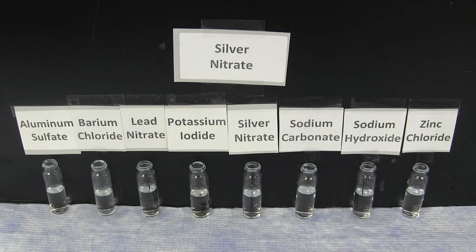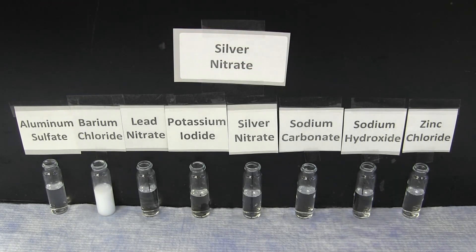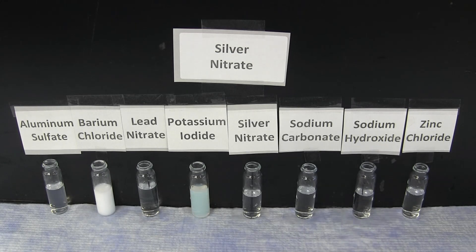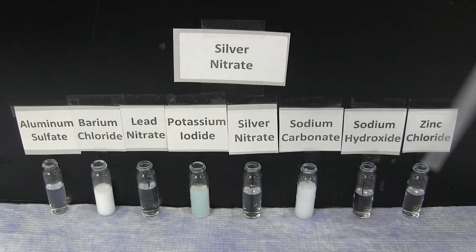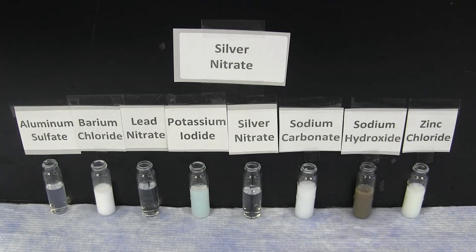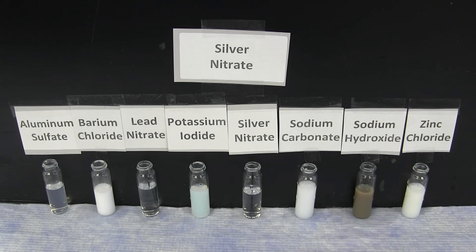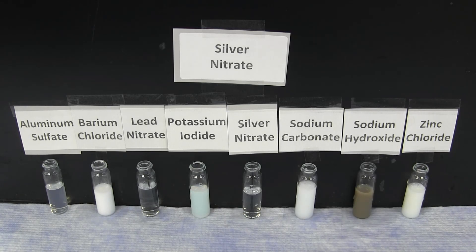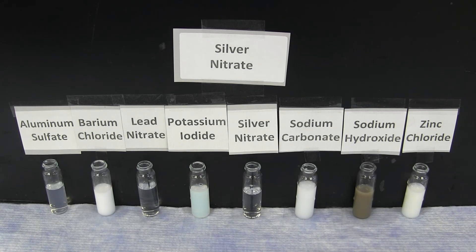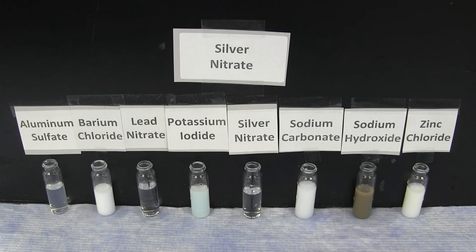The next reaction pattern to observe is the reactions of silver nitrate. It forms a brilliant white precipitate with barium chloride, sodium carbonate, and zinc chloride. It forms an off-white precipitate with potassium iodide, and a brown precipitate with sodium hydroxide. There is no reaction with aluminum sulfate, lead nitrate, or silver nitrate.